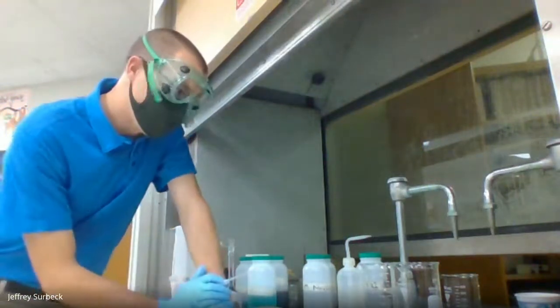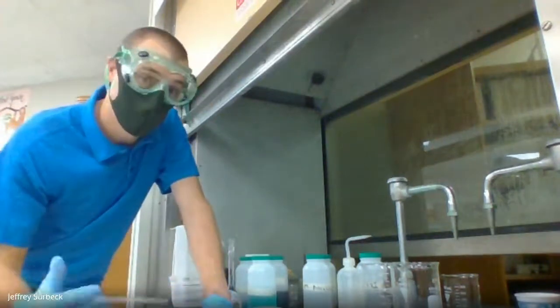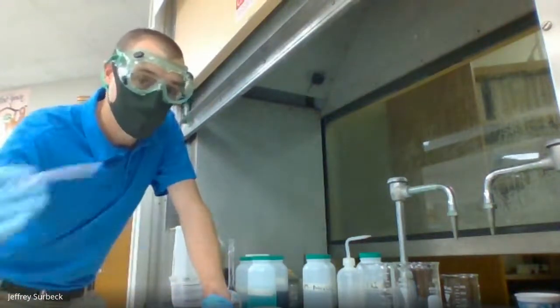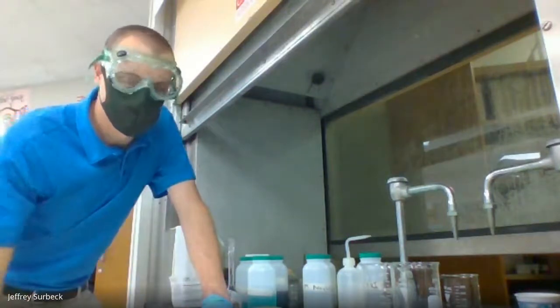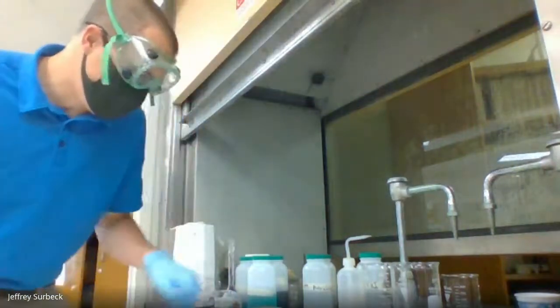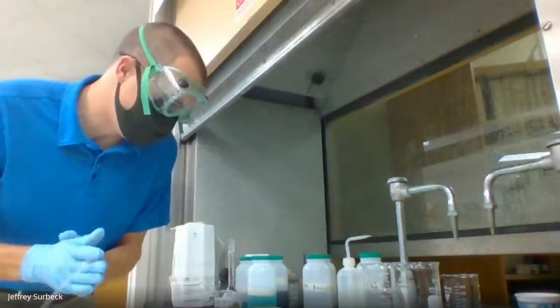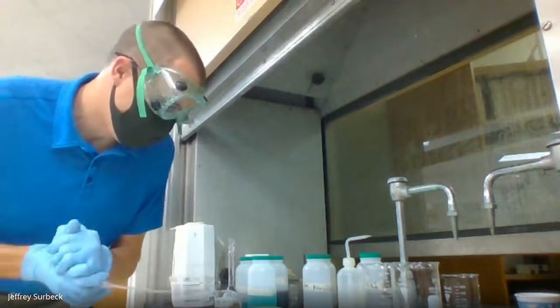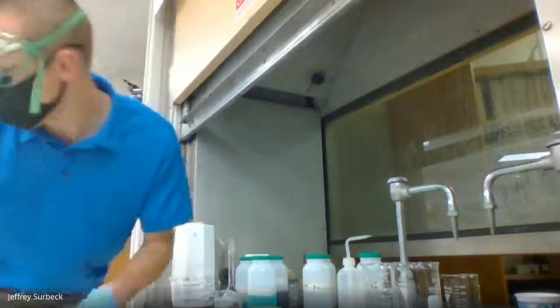What we're going to do here, we're going to see a series of equilibrium reactions, and what you're going to need to do is, as I do the experiment, record in the correct location on your report sheet. So for part 1A, it starts on page 3. The directions say, place about 1 milliliter of 0.1 molar copper(II) sulfate.